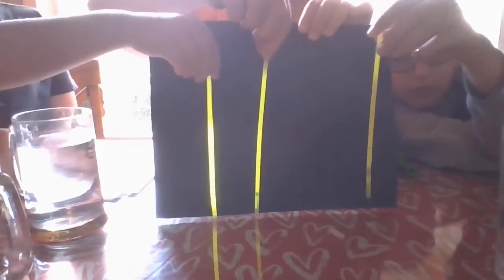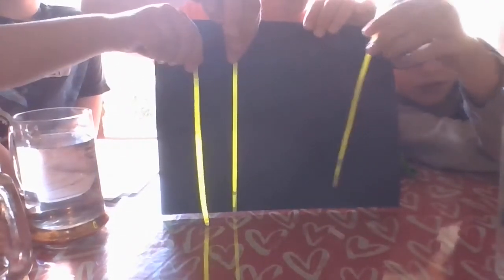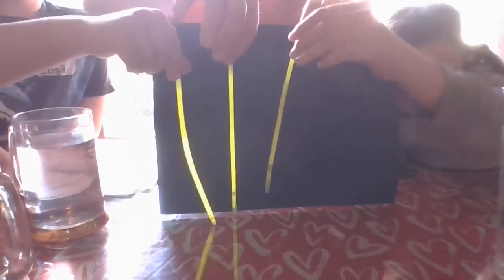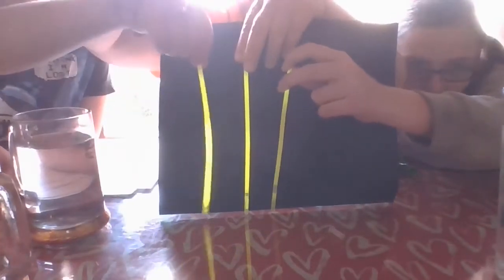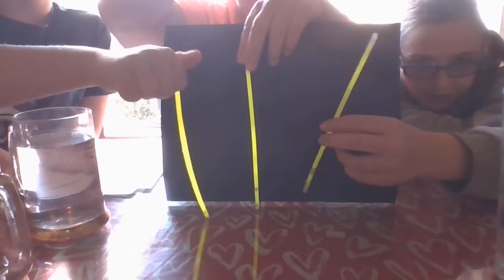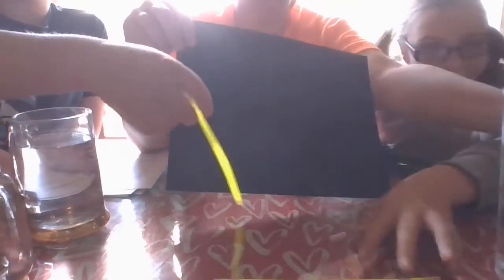Then go ahead and stick them right next to each other. Can you put yours right next to mine? So you see how bright Jace's is. Josie, move yours in to mine. And how light Josie's is. Jace's right here is the hot. This is the warm, and Josie's is the cold. Make sure you're answering our questions. All right, thank you guys. That's the end of experiment 1.